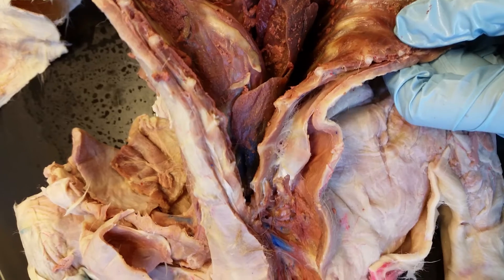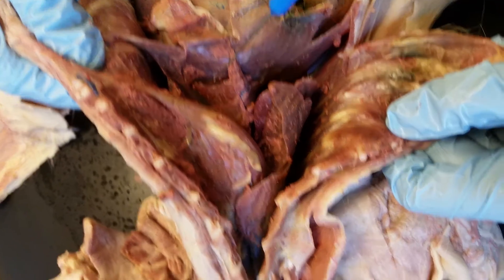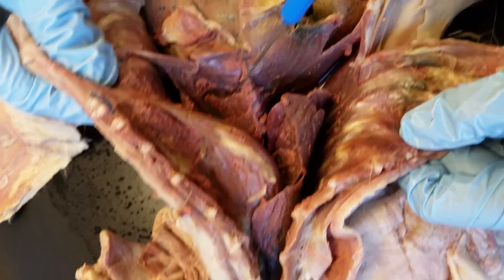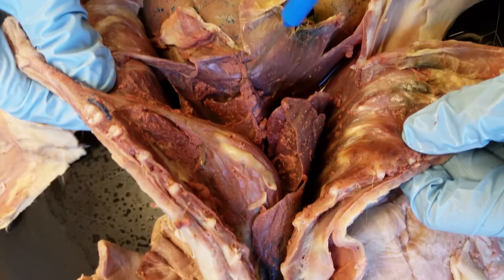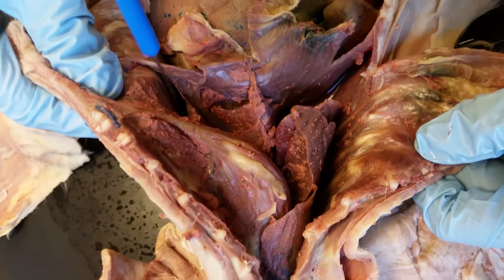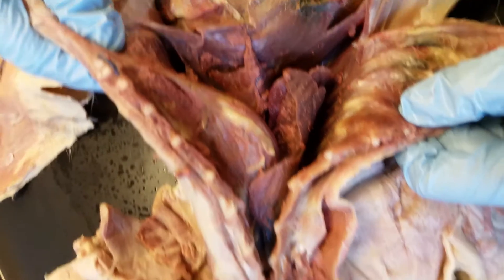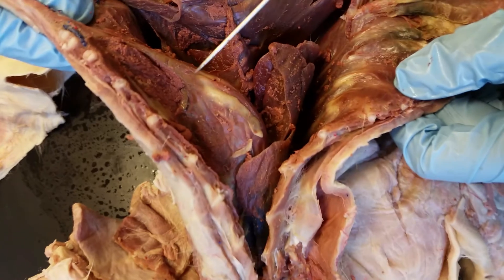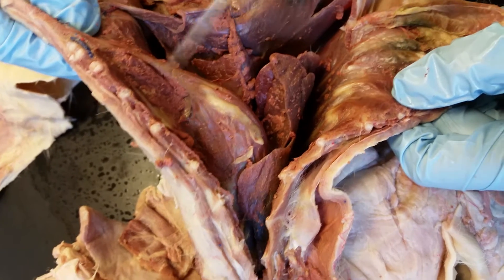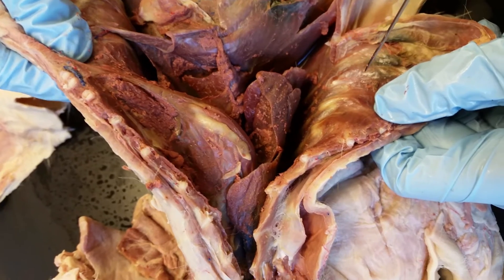Right here and right here is the mediastinal septum — this area right there is the mediastinum cavity. Back in here is another pleural cavity; it's hiding behind his heart. So the mediastinal septum covers the heart, and then underneath, when we cut through there, we'll have the pericardial peritoneum.